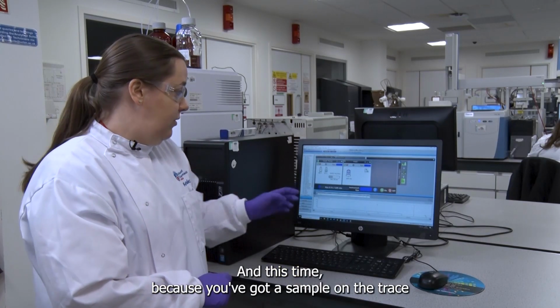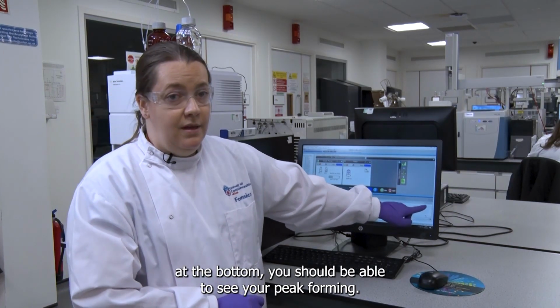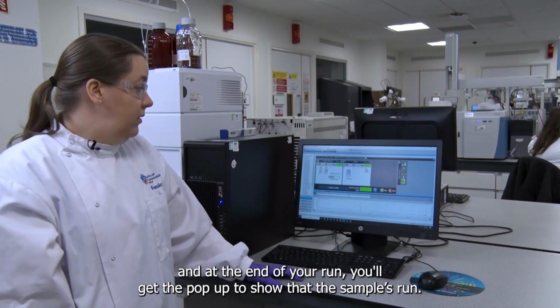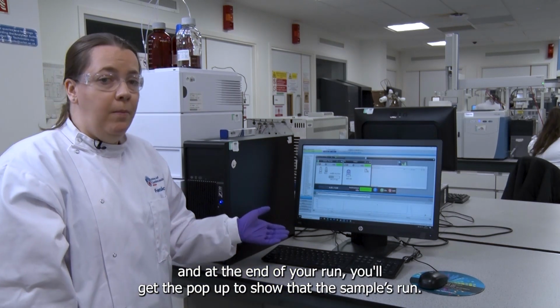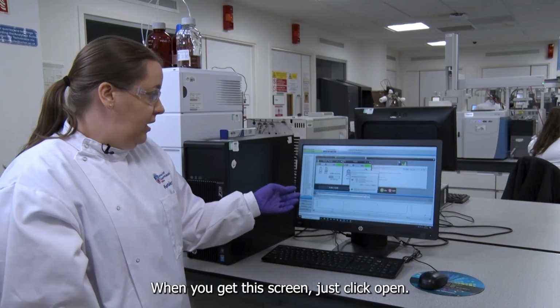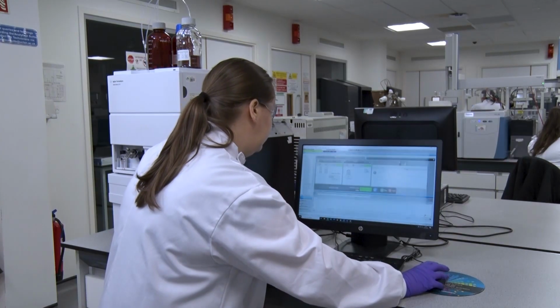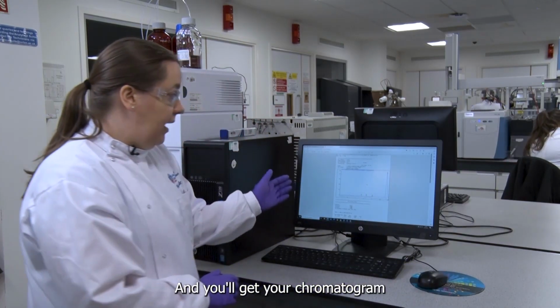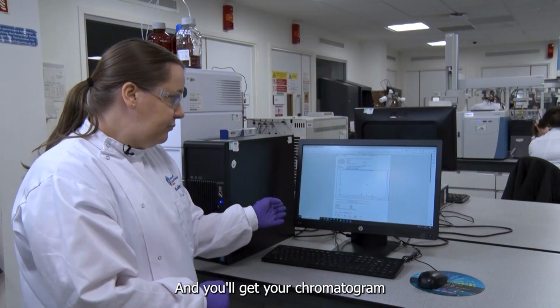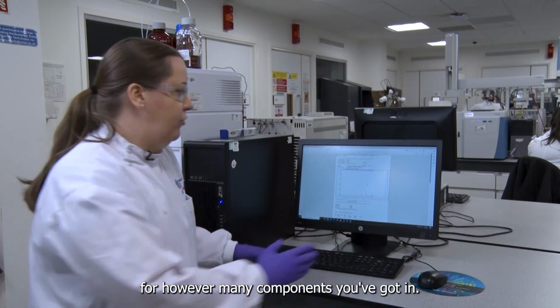And this time, because you've got a sample, on the trace at the bottom you should be able to see your peak forming. And at the end of your run, you'll get the pop-up to show that the sample's run. When you get this screen, just click open. And you'll get your chromatogram showing peaks for however many components you've got in.